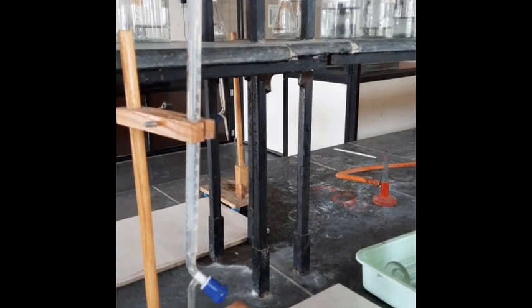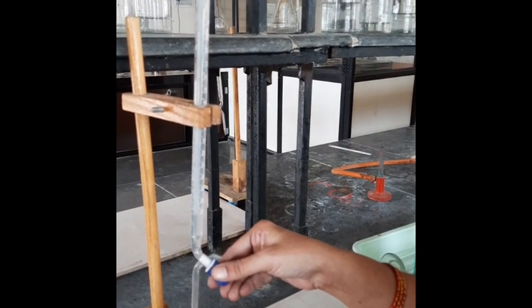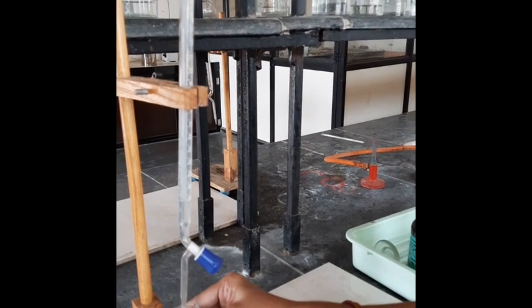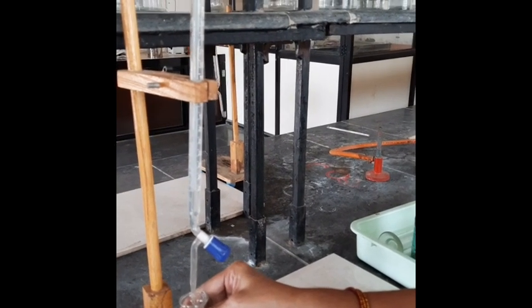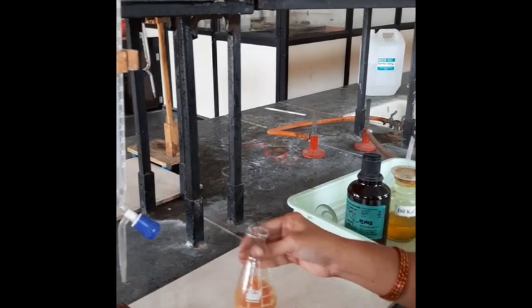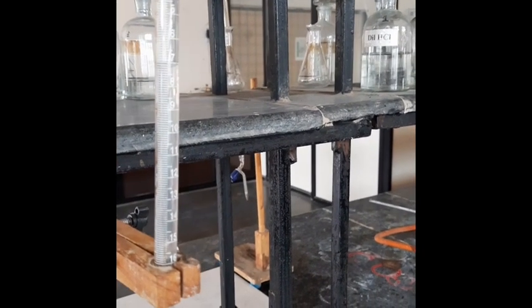Continue adding silver nitrate drop-wise from the burette until the color changes to brick red. Stop the addition and observe the color — in the beginning it was yellow, now it has turned to brick red. Your reading is 7.1.